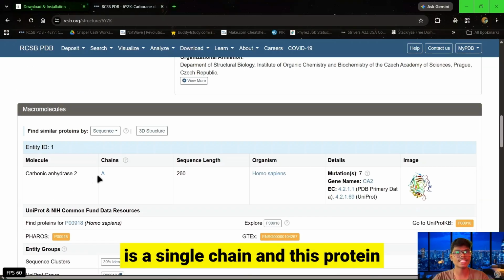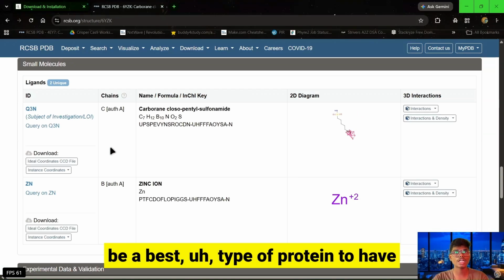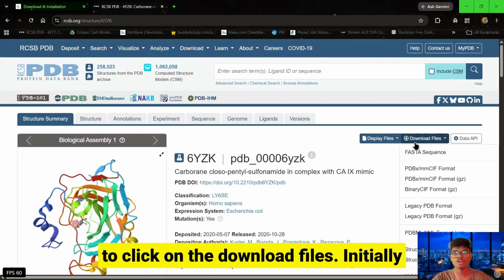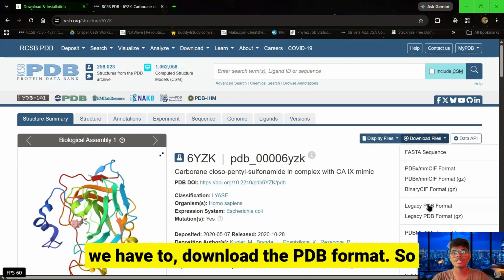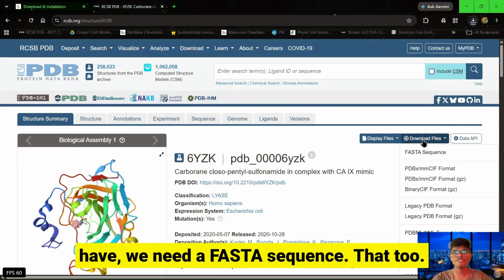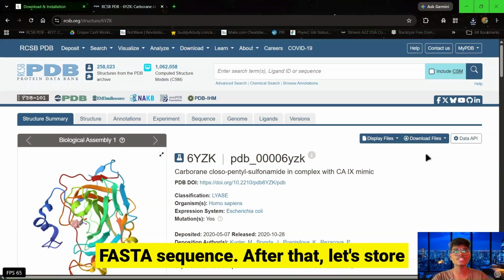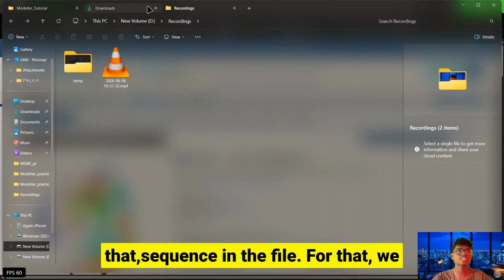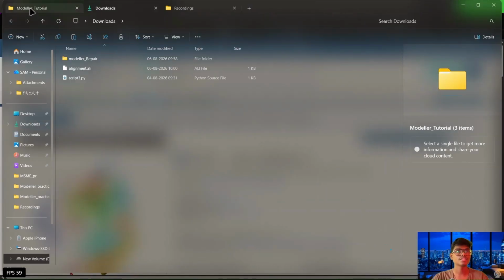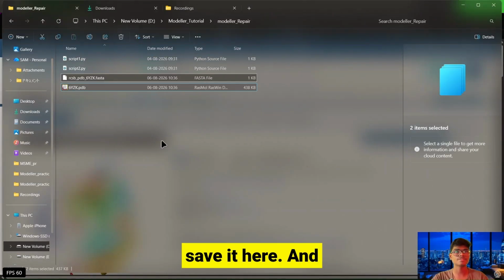So there is a single chain, and this protein contains only a single chain, so it will be a best type of protein for a practical demonstration. Then we have to click on download files. Initially we have to download the PDB format, so let's click there, and then we need the FASTA sequence, and I am going to explain why we need this FASTA sequence. After that let's store that sequence in a file. For that we have to click here, create an alignment file, and save it here.